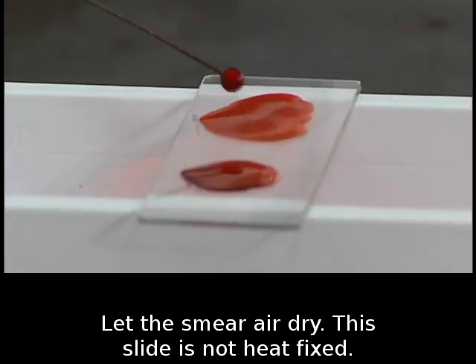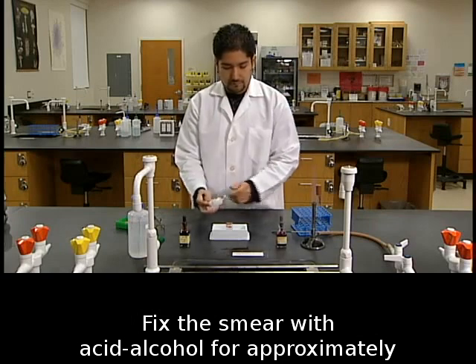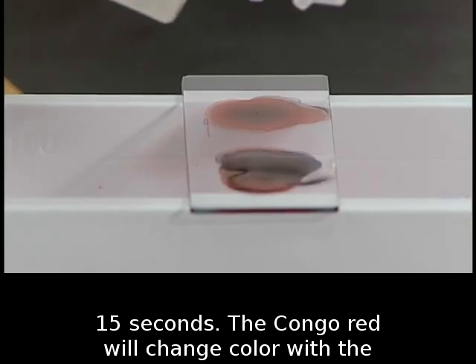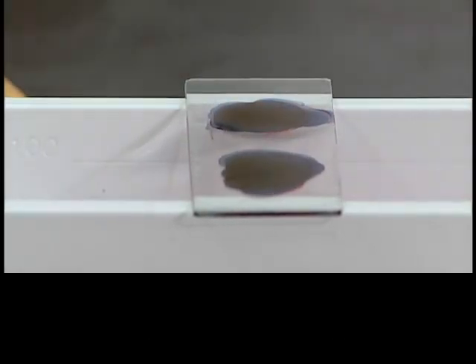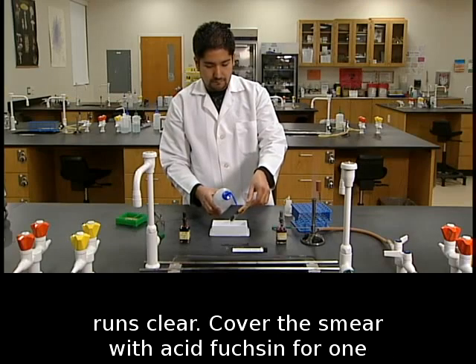Let the smear air dry. This slide is not heat fixed. Fix the smear with acid alcohol for approximately 15 seconds. The Congo red will change color with the decreased pH of the acid. Wash the smear with distilled water until the water runs clear.